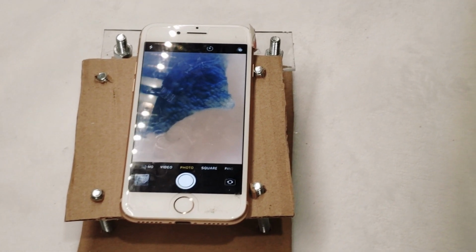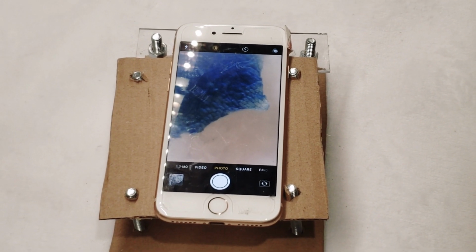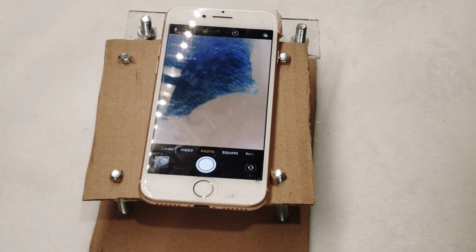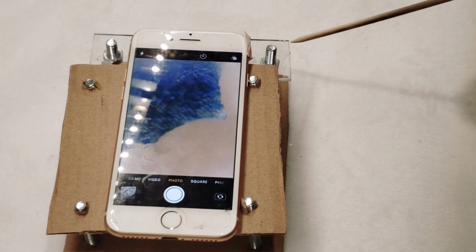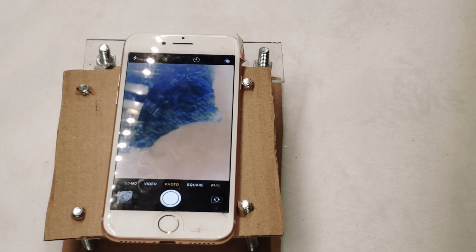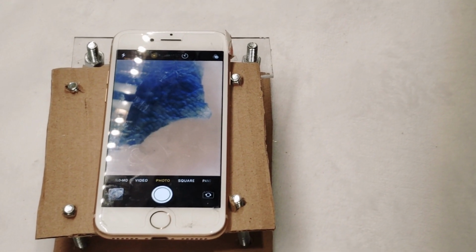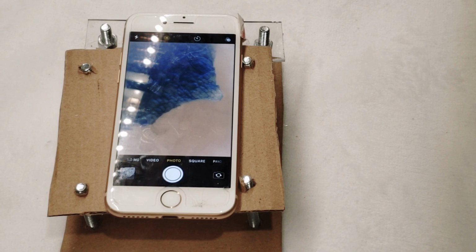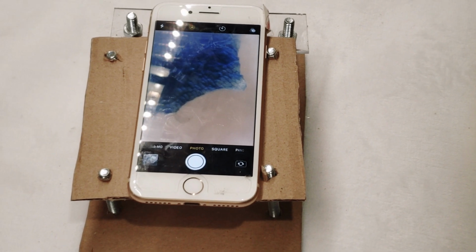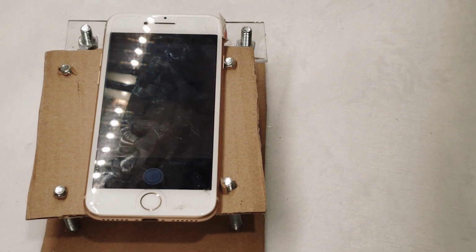So all in all, total materials, it costs us about $5 for the laser diodes, which comes to about $1 for the two that we used, $2 for the 6 bolts, and then the cardboard was just trash. The Lexan was stuff that I had left over from a project, but you can use any clear plastic. You could use a CD case cover, just any clear plastic, really. So really the rest of it's kind of just made out of junk, and it's not necessary either. The stand was just to make it easier to focus in. You can just do it without the stand at all if you want. And yeah, it's a pretty simple and pretty neat project, pretty versatile.